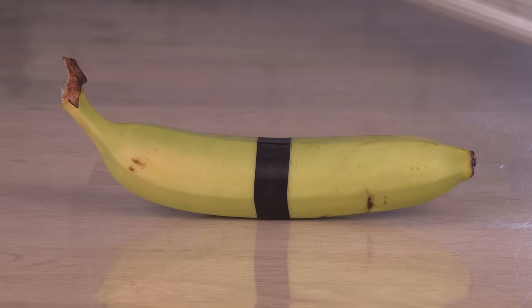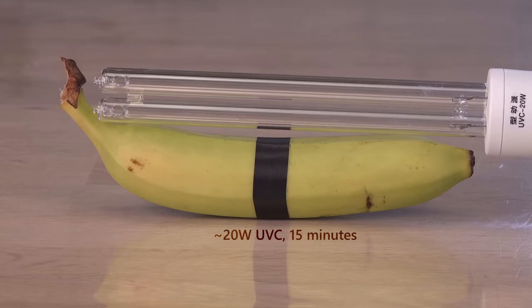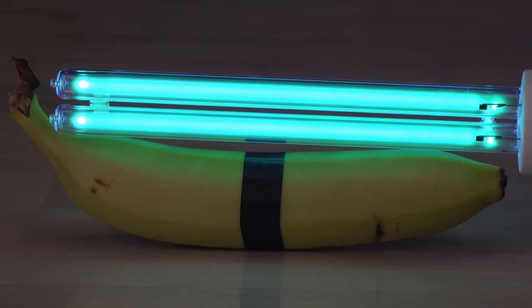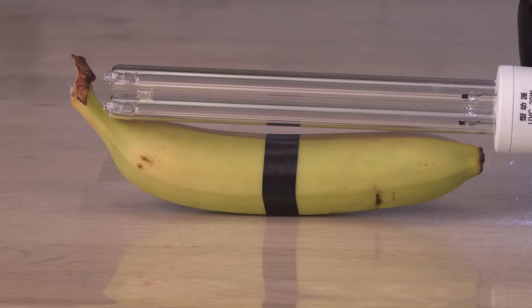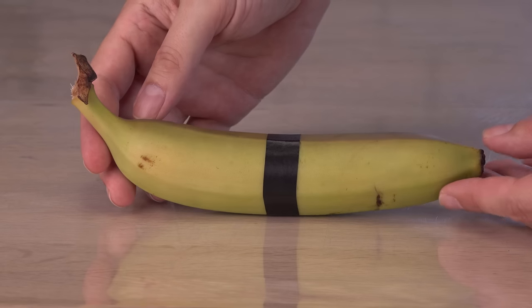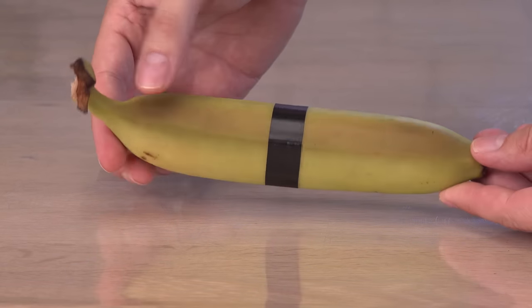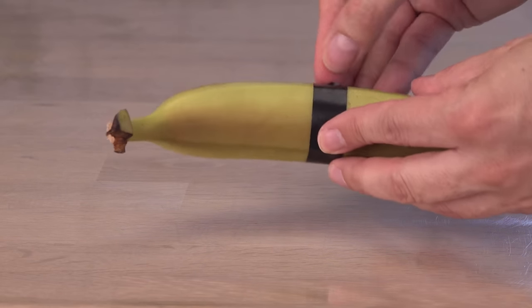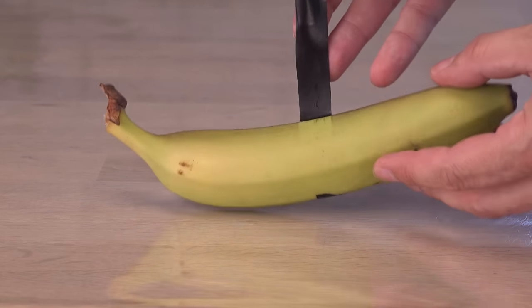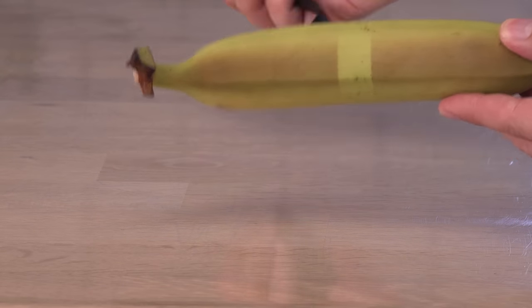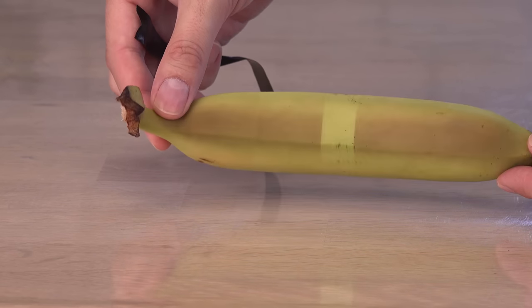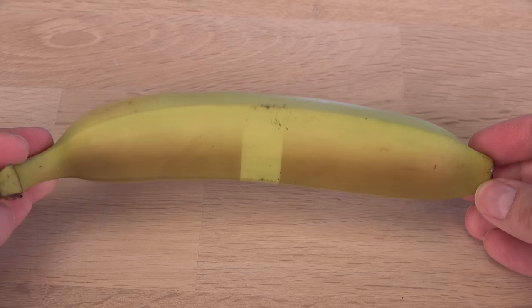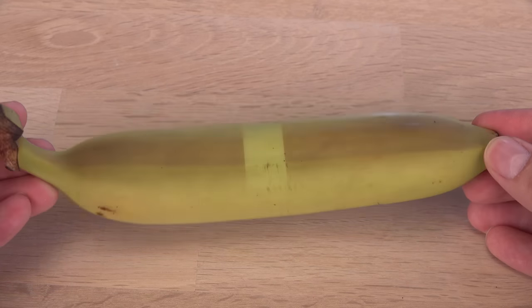I then up the ante and used the 20-watt UVC fluorescent tube up close for 15 minutes. Okay, this time I am seeing a clear difference. But is it really from UVC alone? Wouldn't the heat radiation from the lamp have this effect? I think this method needs further investigation. But for now, I'll switch to a more scientific instrument than a banana.